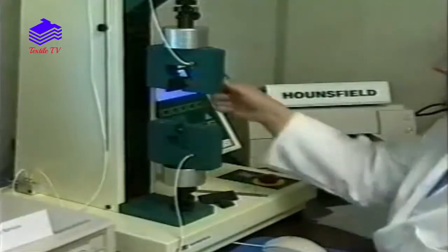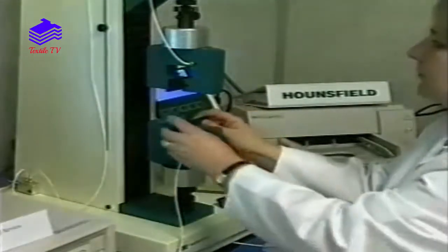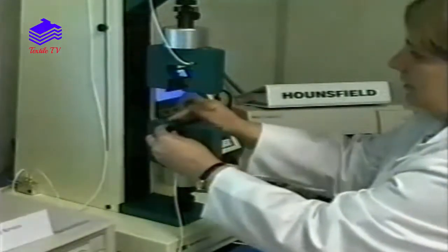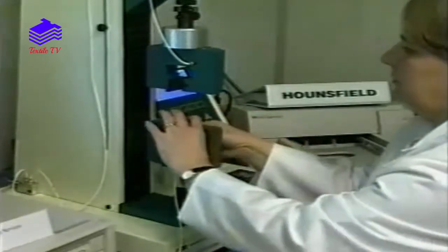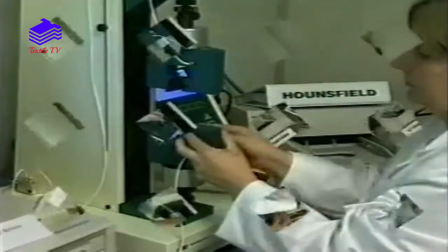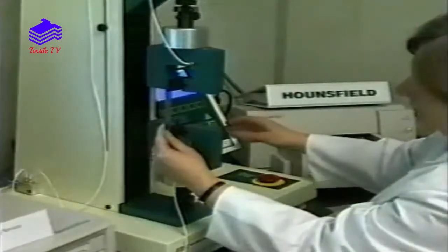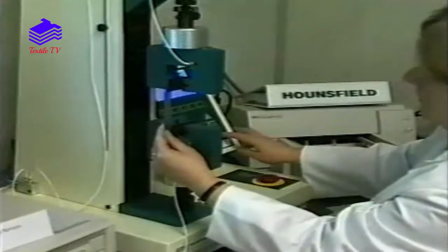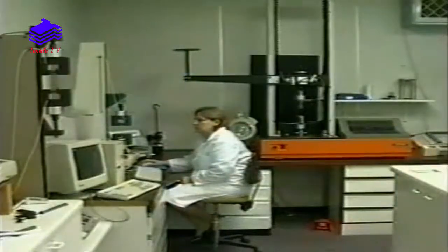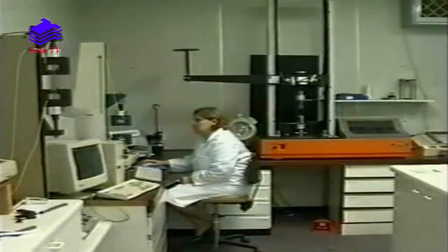The Hounsfield is set up with the correct jaw faces in both the top and bottom holders, the back jaw face being 75mm by 25mm and the front face being 25mm by 25mm. The gauge length — the distance between the top and bottom jaws — is set to the specified distance. The appropriate test program is selected from the computer menu and the specified details entered onto the screen. The computer will set the machine up into the testing mode.